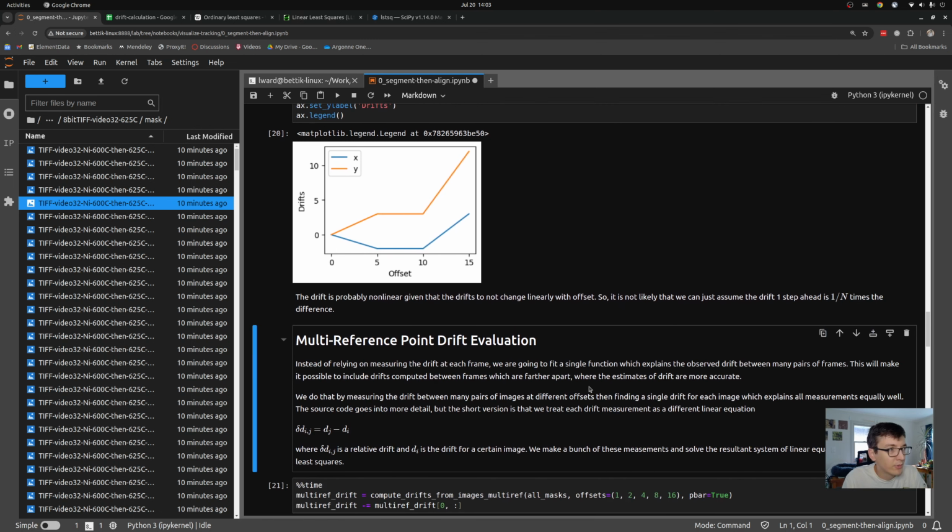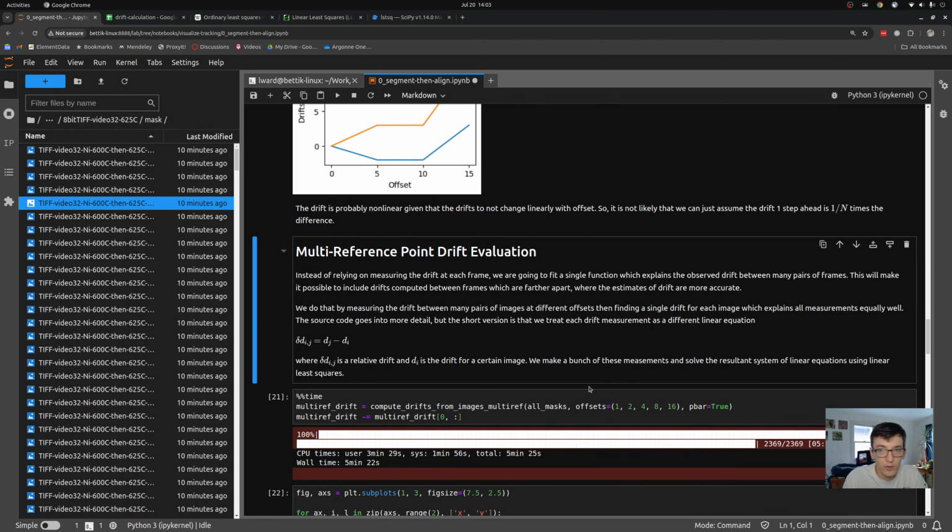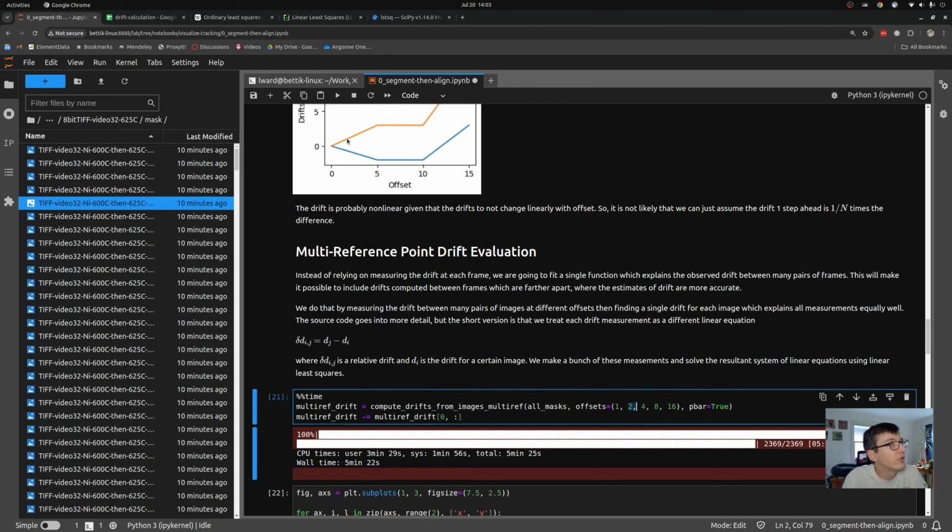What we ended up doing was what we're calling a multi-reference point, where I compute the drift between each pair of images that are adjacent to each other, that are every 2, every 4, every 8, and I can use all of these measurements of drift together to form a single model for what I think the drift was over time.